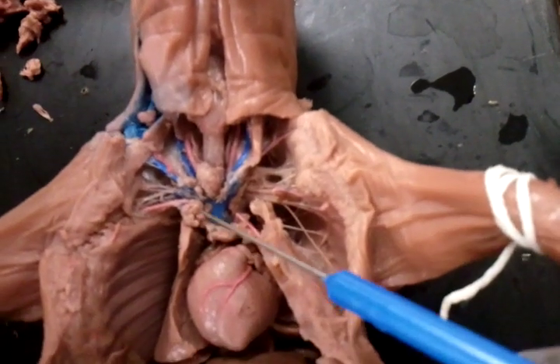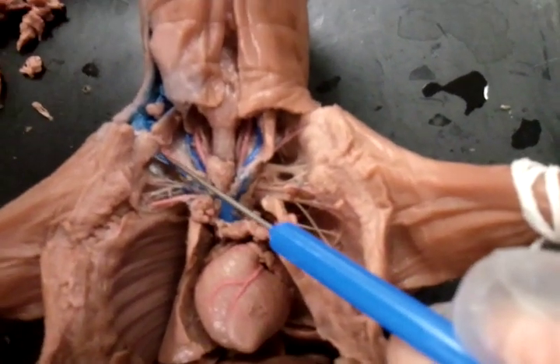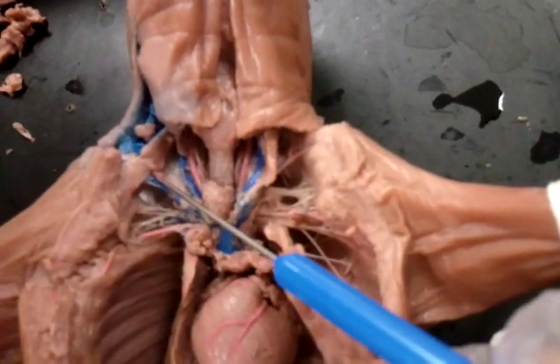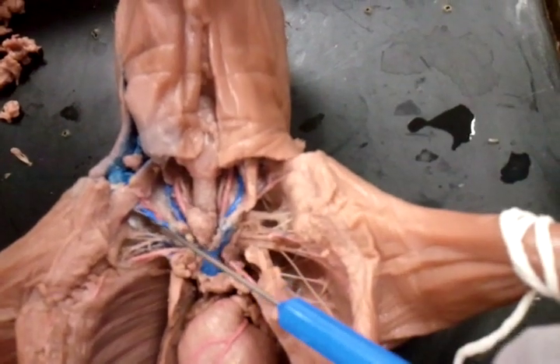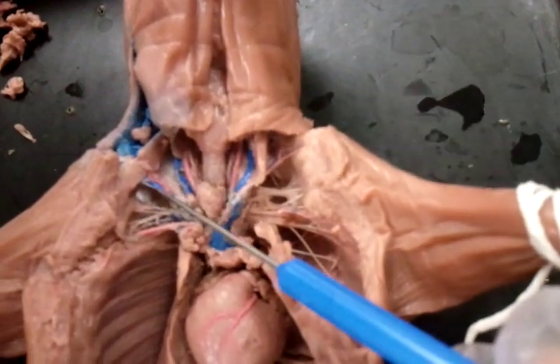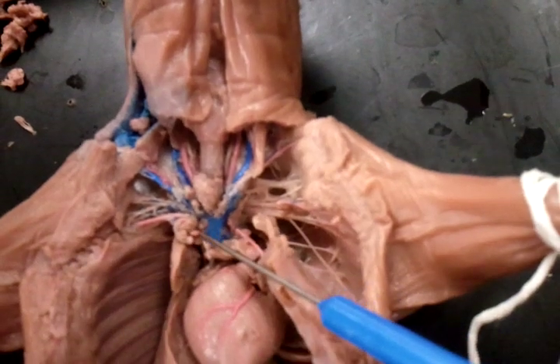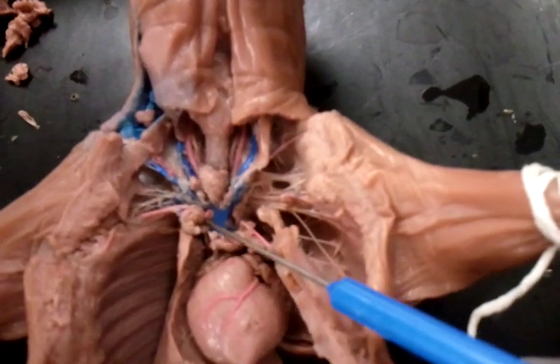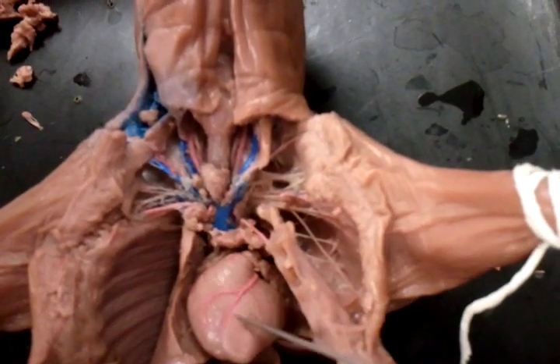Let's go to the heart. Oh actually, brachial — brachiocephalic vein and trunk. It's under this, it's under all this meat.